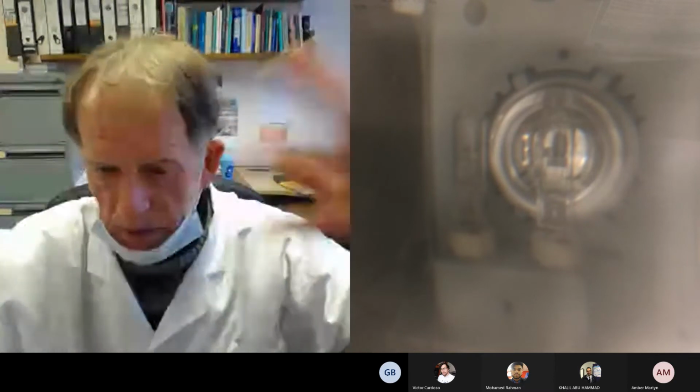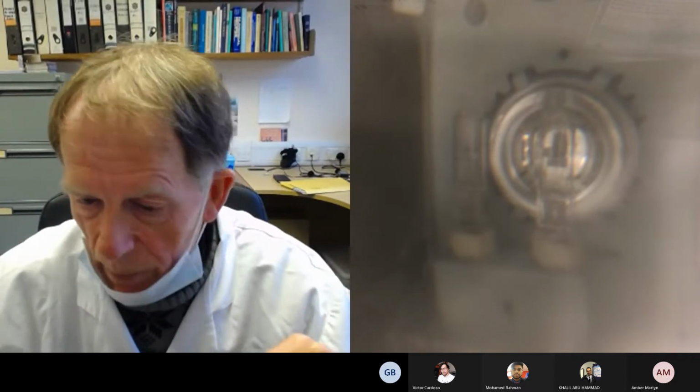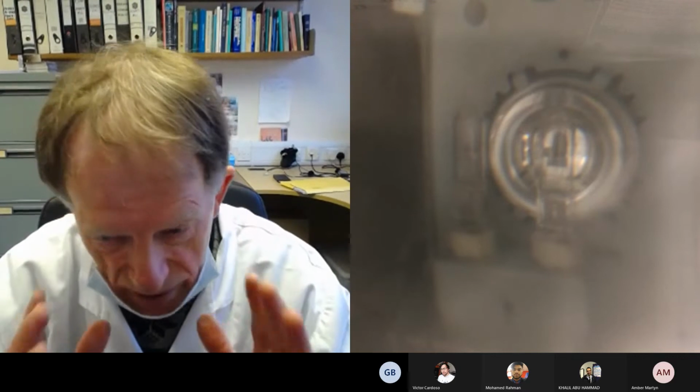So when you measure the protein concentration, it usually comes out less than what you think it is because of water that's already bound to the protein molecule before you put it in solution, because proteins absorb water vapor from the air and things. So 10 mg per mil is a very reasonable value. And when making calculations, determinations of this sort, always look and see if the answer makes sense.